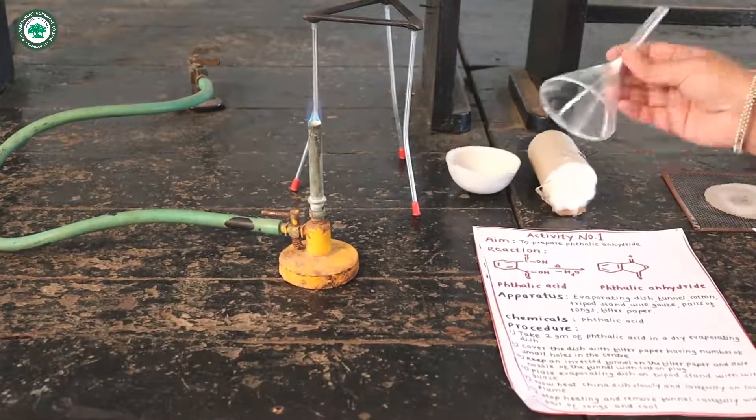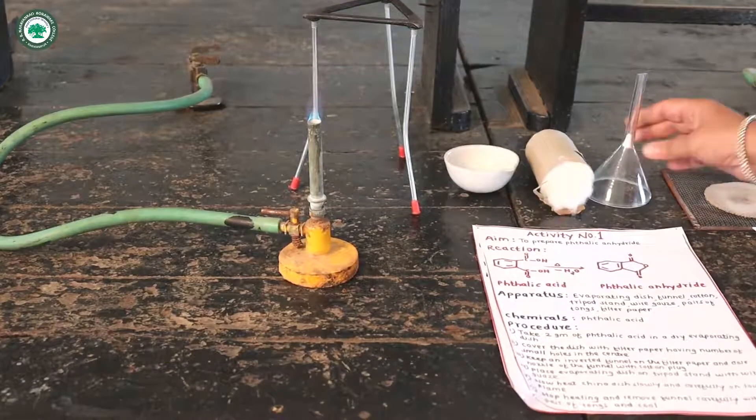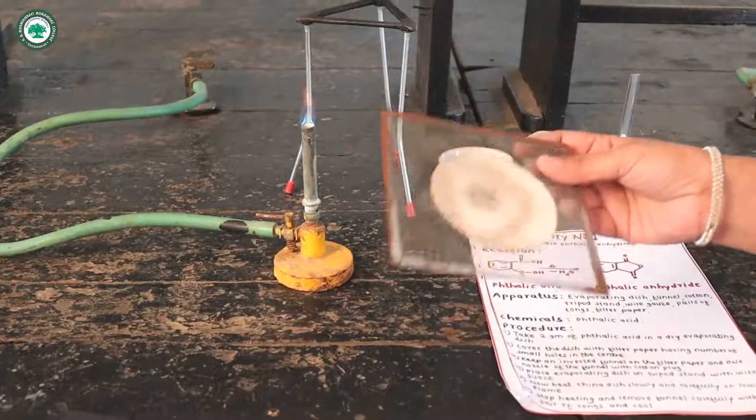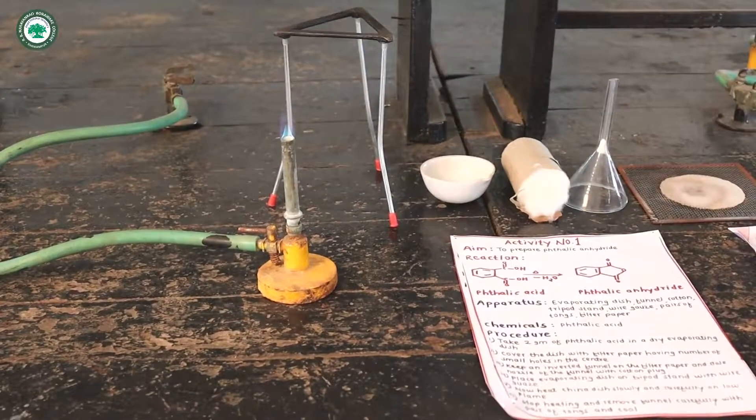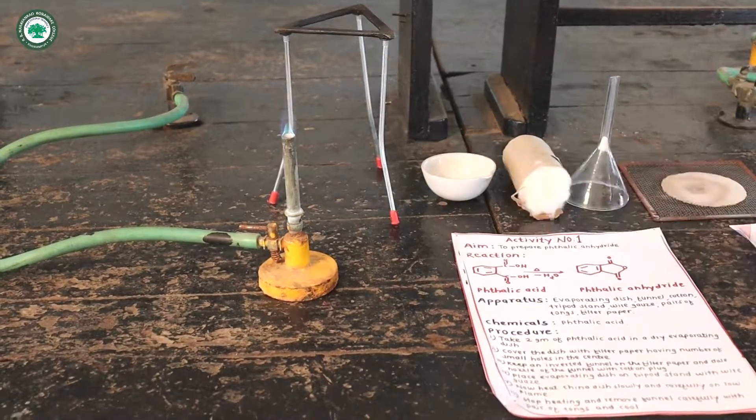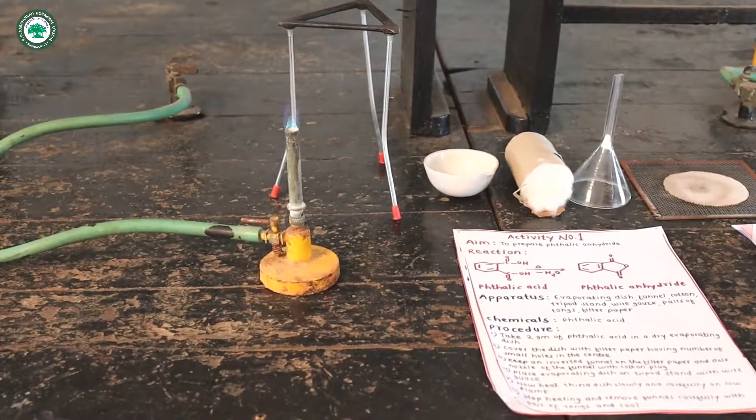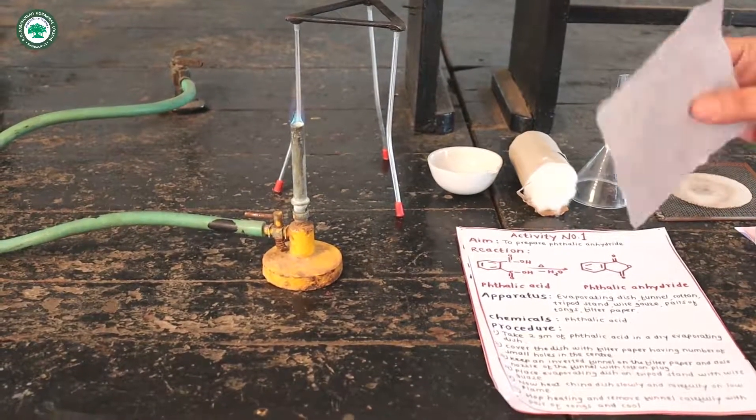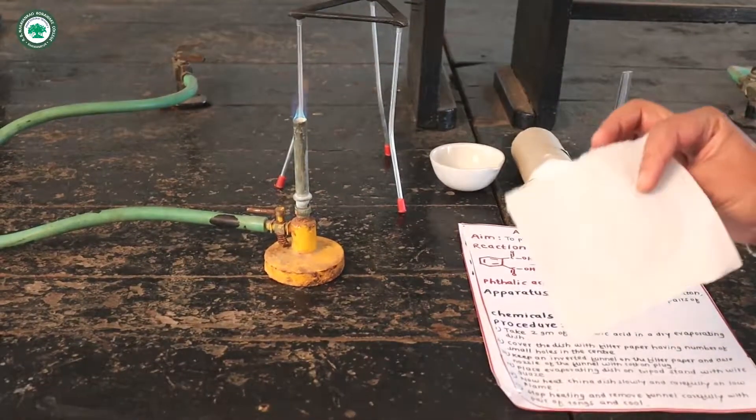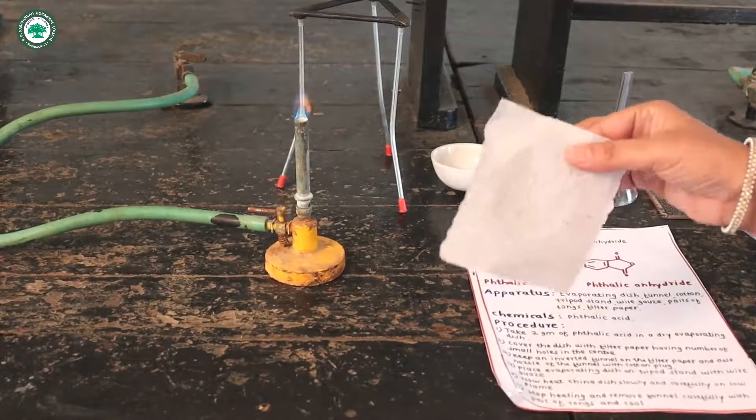Funnel, wire gauze, pair of tongs and burner, and filter paper with number of small holes at the center.